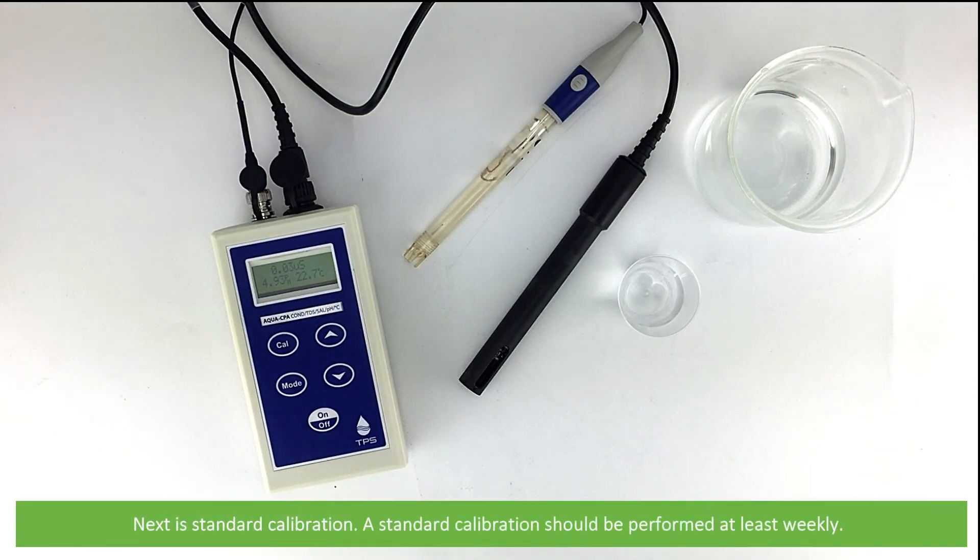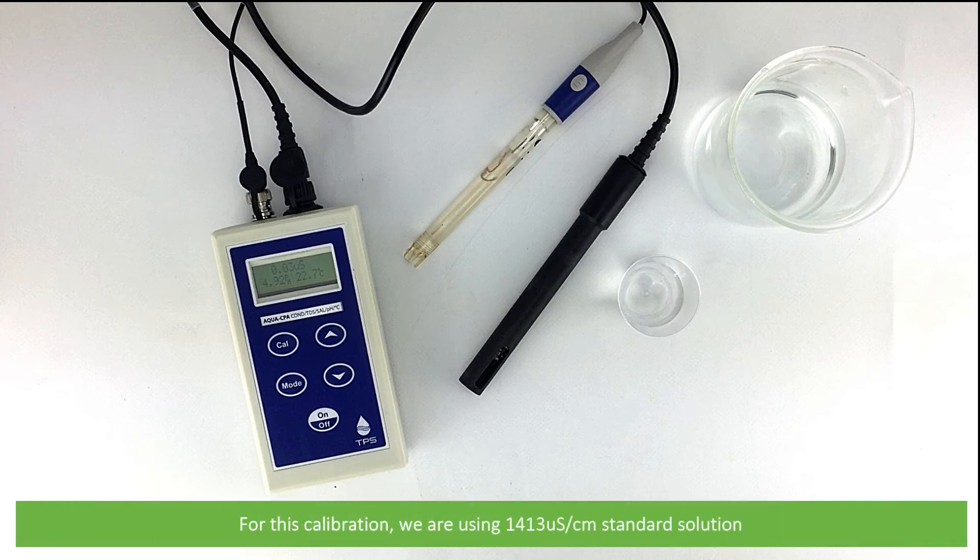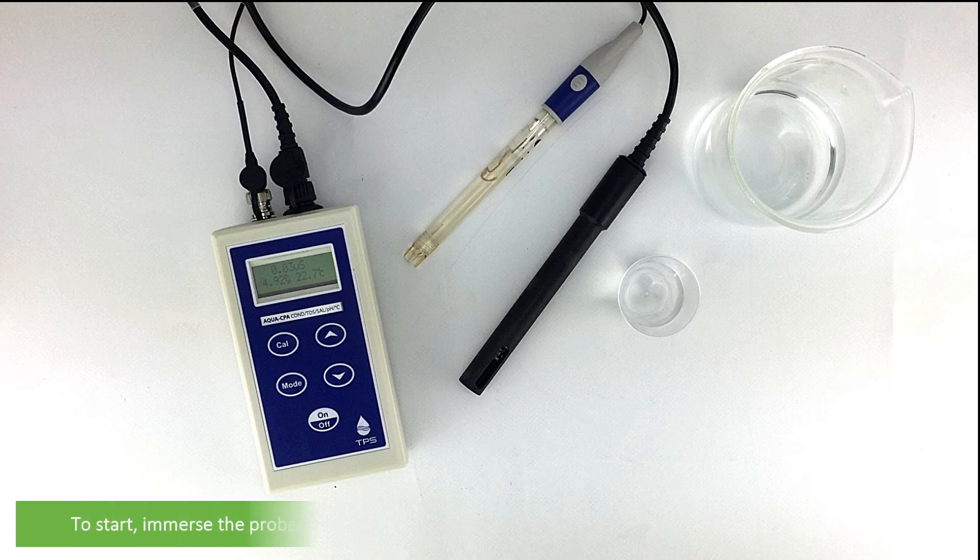Next is standard calibration. A standard calibration should be performed at least weekly. For this calibration, we're using 1413 microsiemens per centimetre standard solution. To start, immerse the probe into the standard solution.